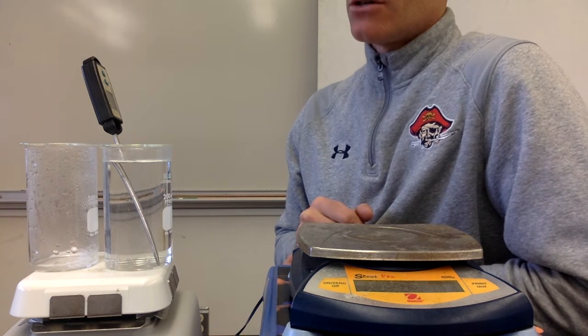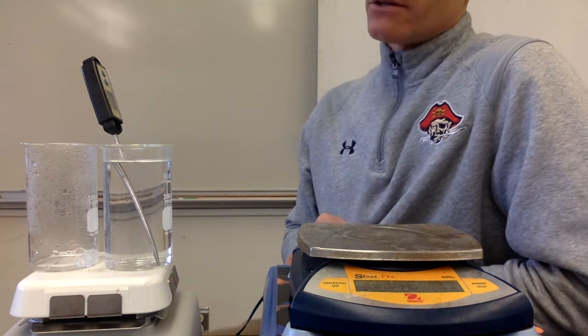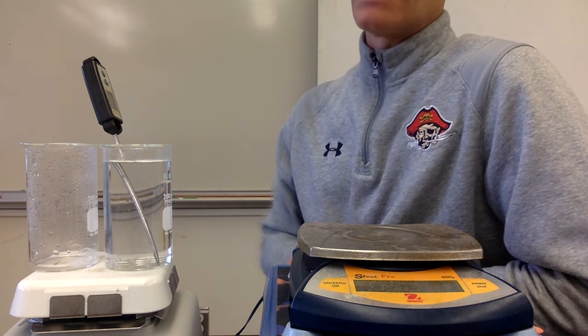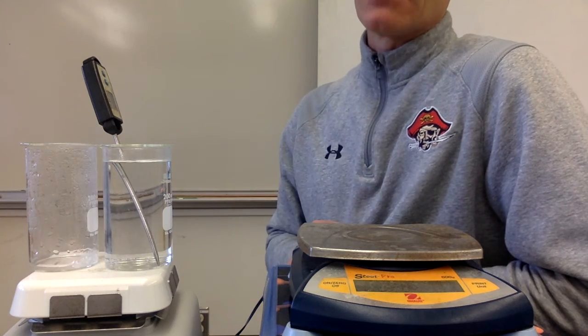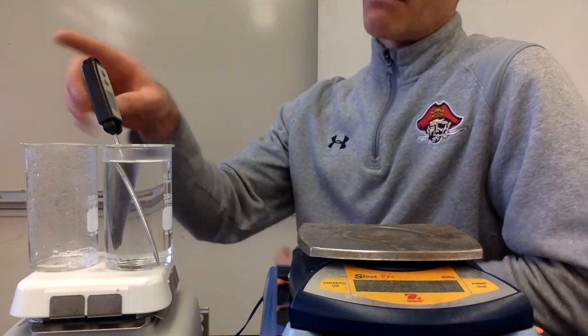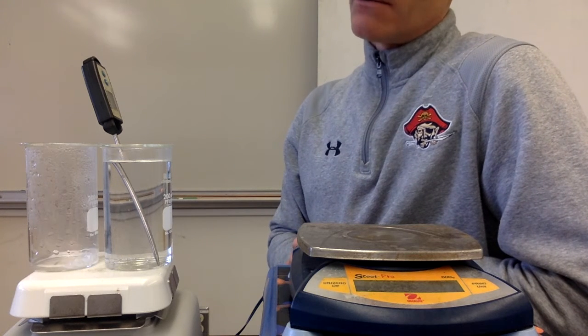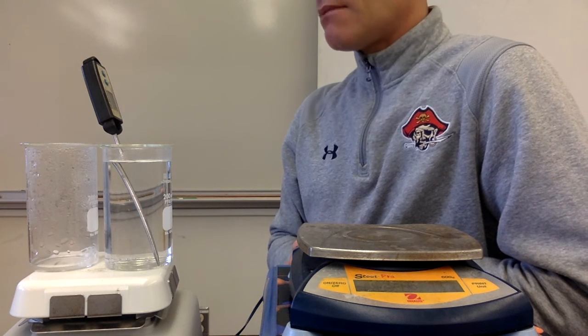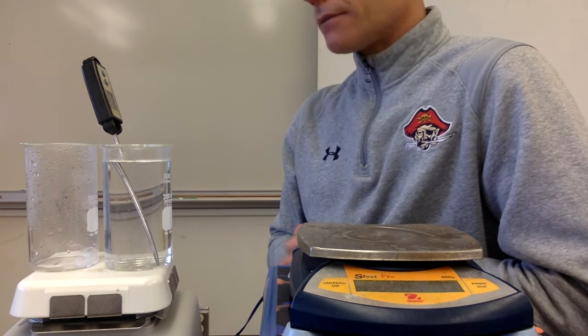The heat of vaporization is usually larger than the heat of fusion, because there's a big difference between a liquid and a gas, right? Liquids and solids are both condensed, so the particles are both pretty close together. But when you're turning this to a vapor, you're separating the particles completely, and so that's going to take quite a bit of energy. That's why this took a little bit of time, and that's why it's taking a significant amount of energy.